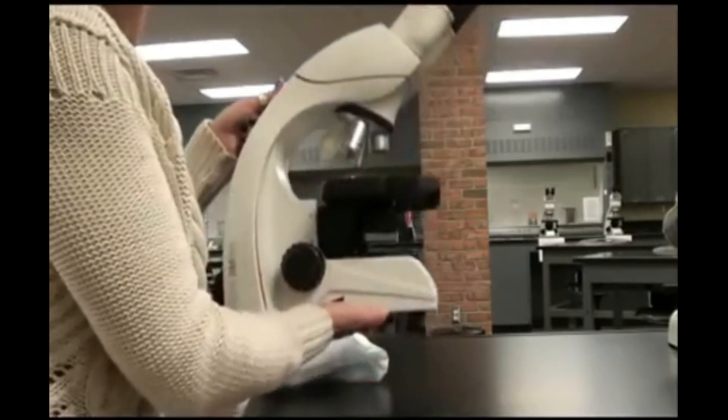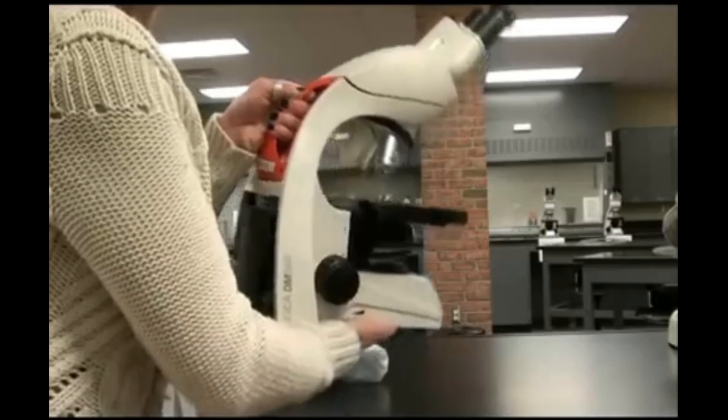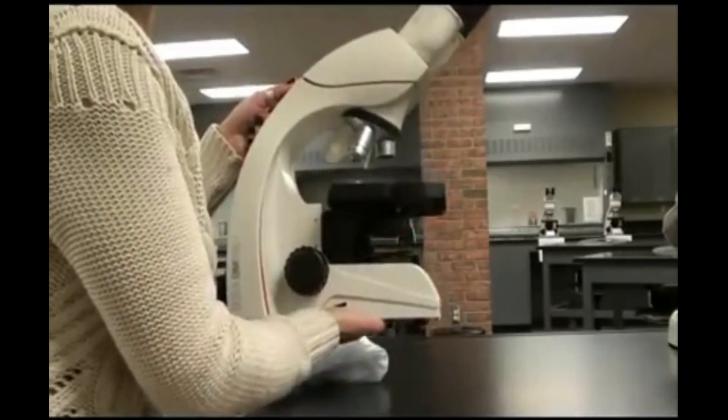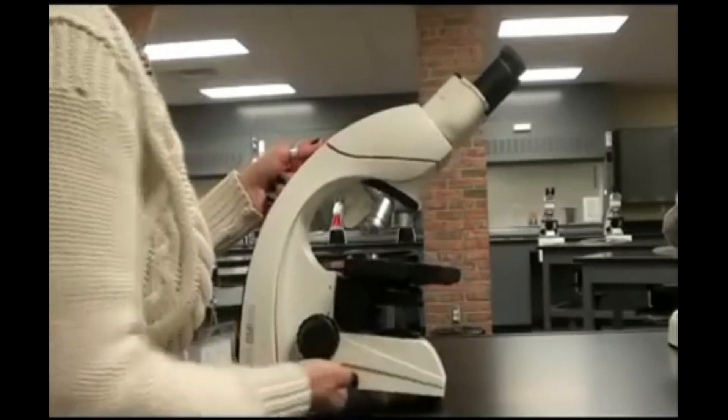Whenever you transport your microscope, you want to make sure to hold it both by the neck and the base. This scope has a nice handle right in the neck and then have your other hand beneath the base.